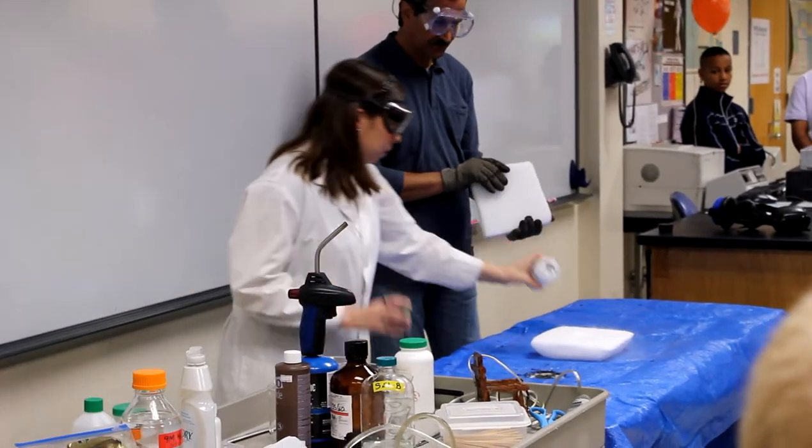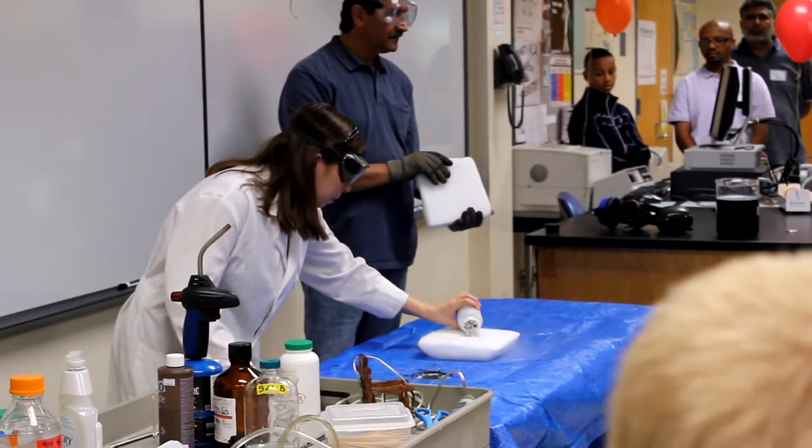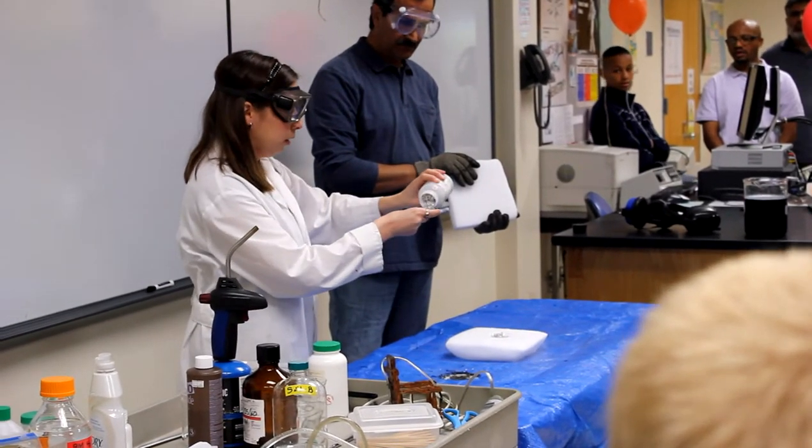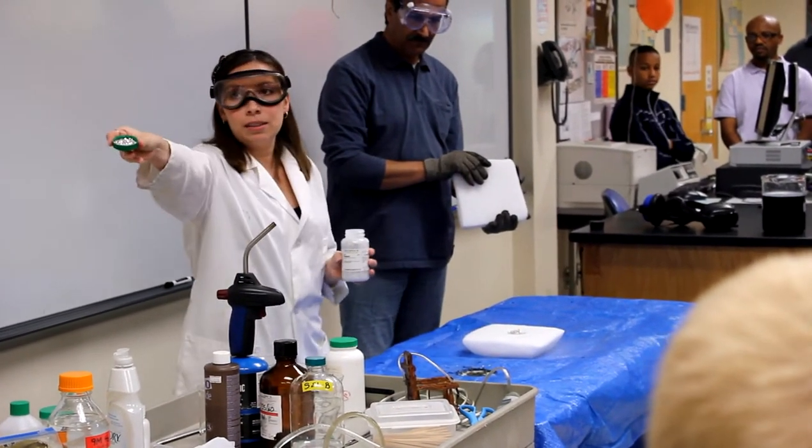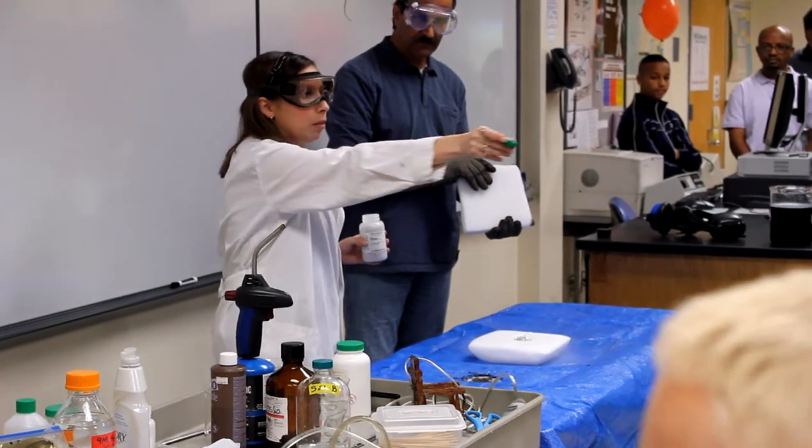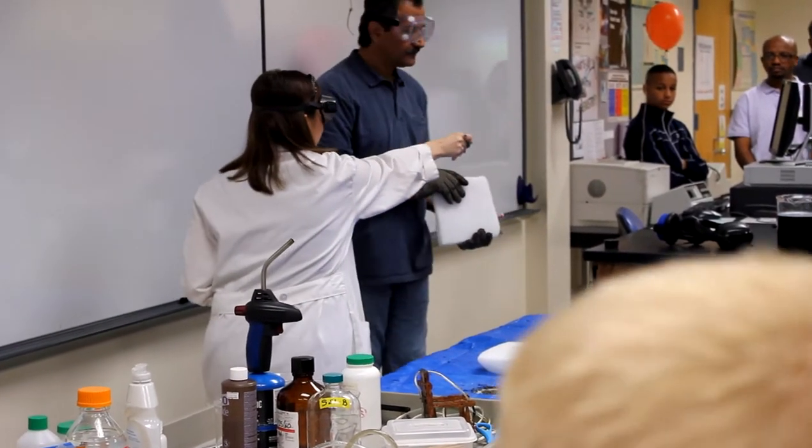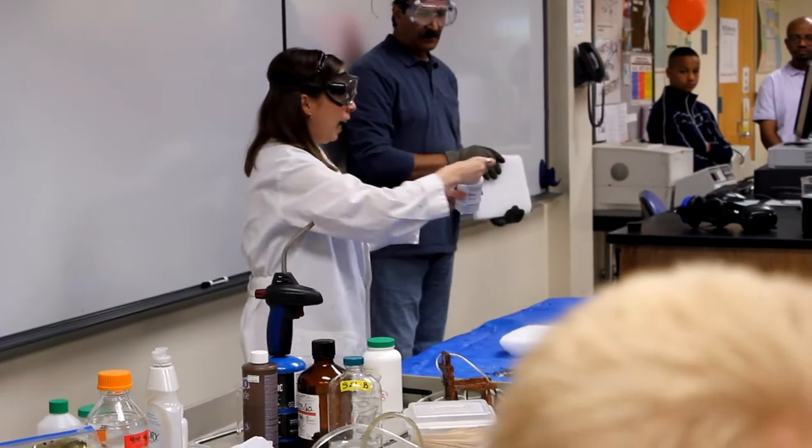So I have some magnesium. And this magnesium metal, if you guys can see, is kind of silver, shiny colored metal. It's also a very reactive metal.